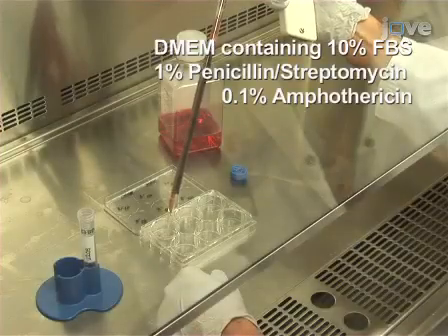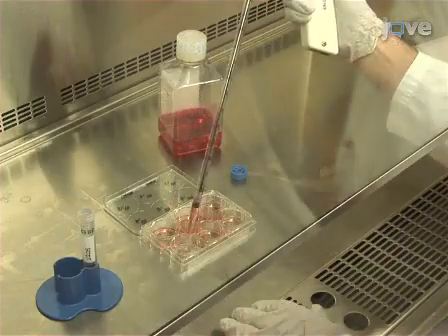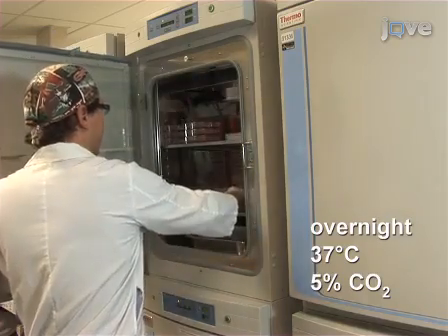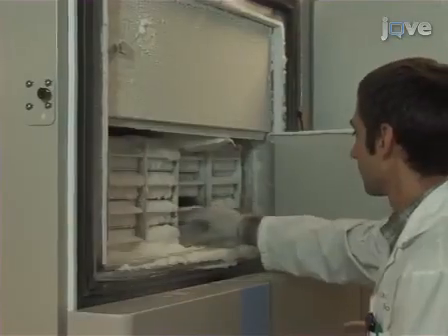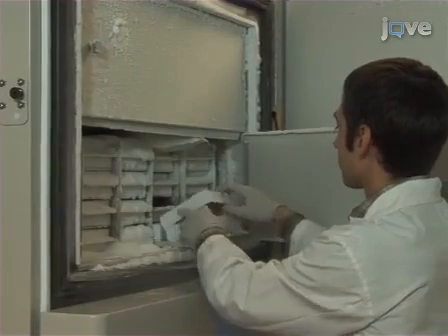Set up a 6-well plate containing 1 million live U2OS cells per well in full medium and incubate overnight in a 37°C, 5% carbon dioxide humidified incubator so that the wells reach 95% confluency. The next day, retrieve the previously weighed infected tissue samples.